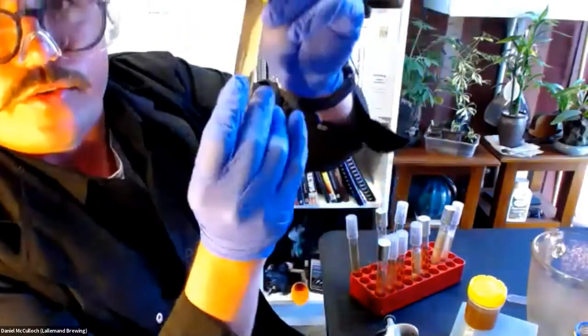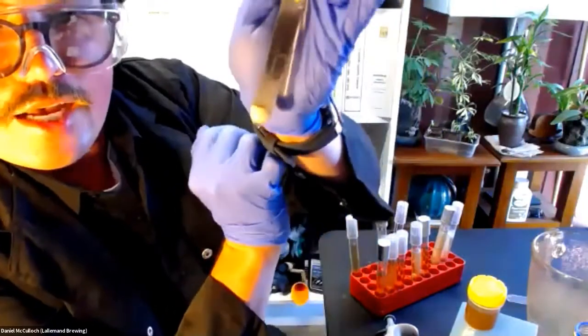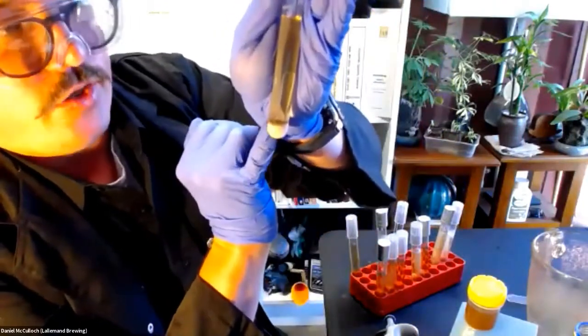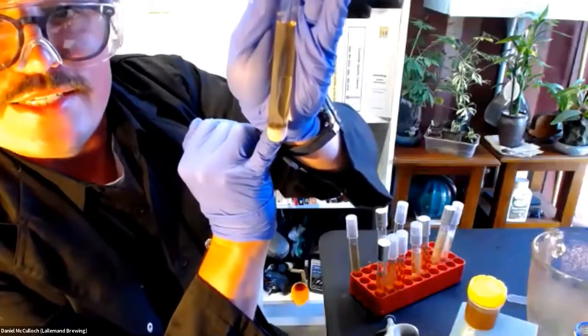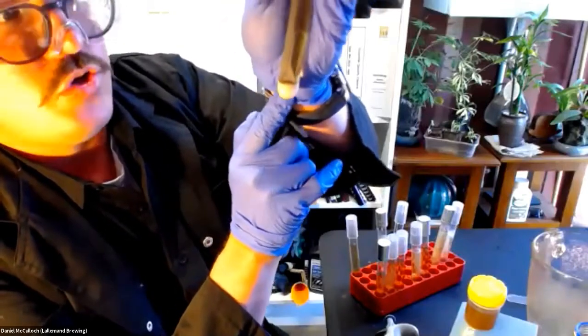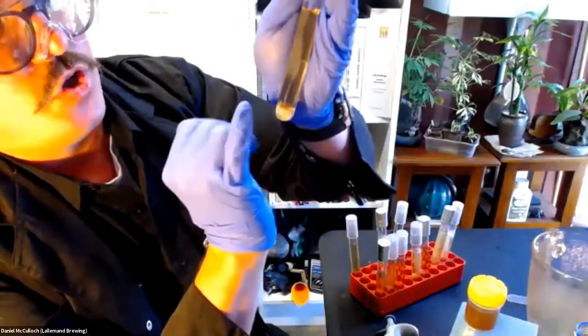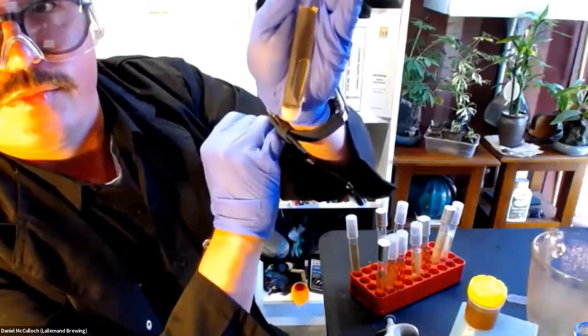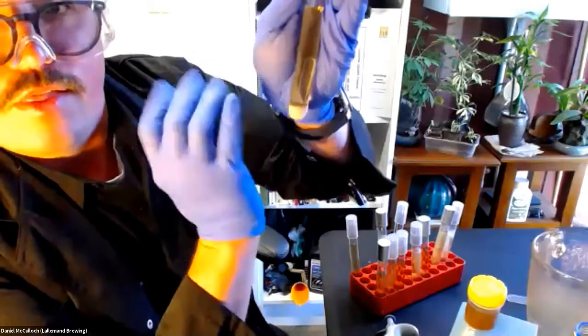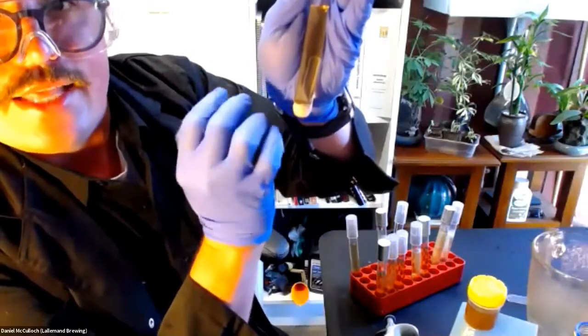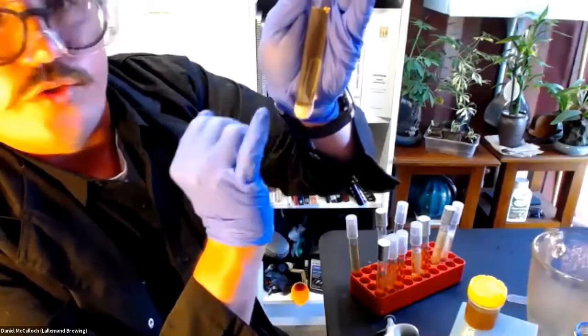Here, just for comparison, I've actually put a large amount of Windsor into this test tube. You can see how much is in there, a huge amount. You can see there's been no bubbles and no gas consumed or created by that yeast, because we know that there's no contamination in that yeast with all the testing that we do.